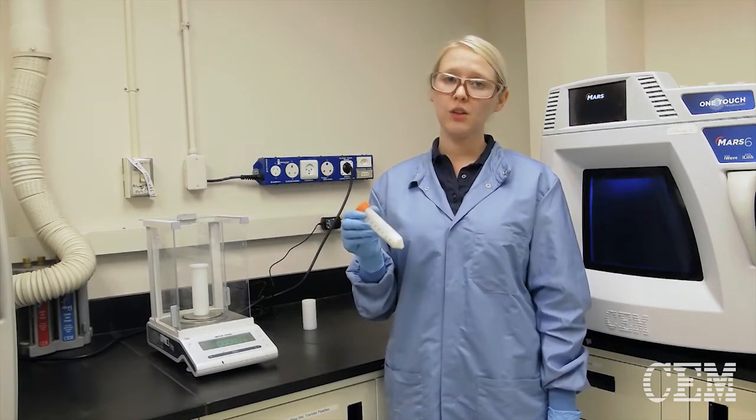The best way to grind it is to either use a cryogrinder or just regular grinding.